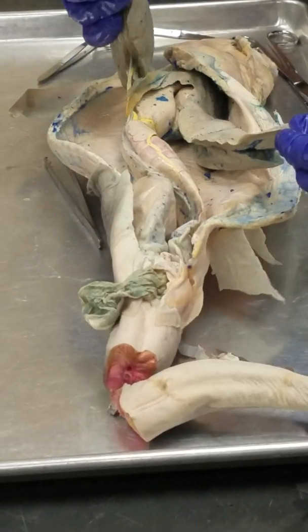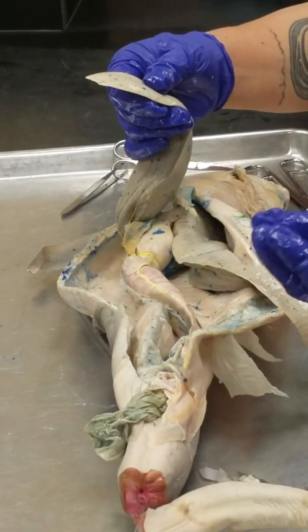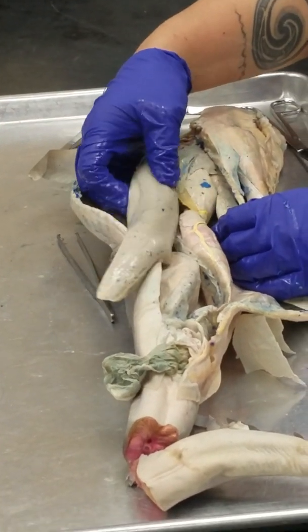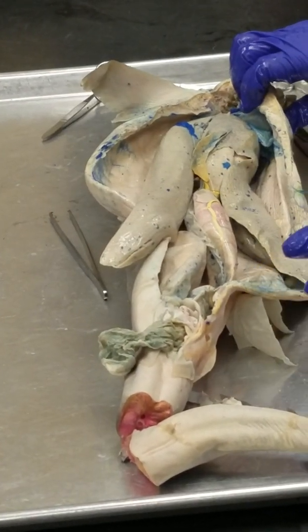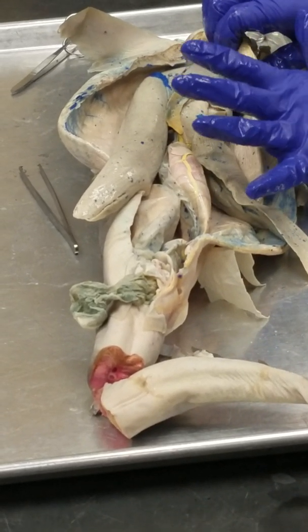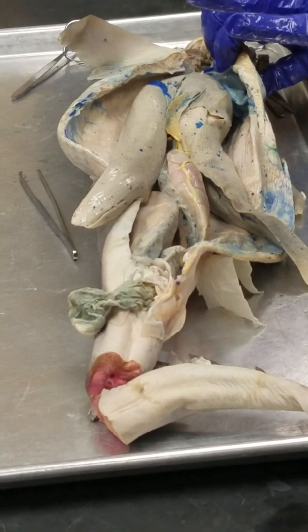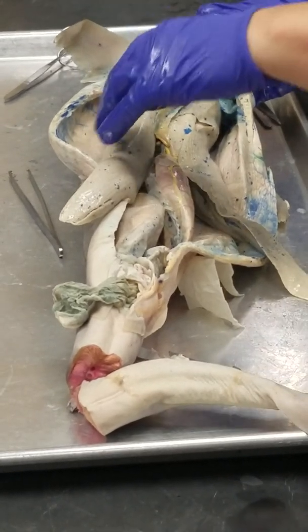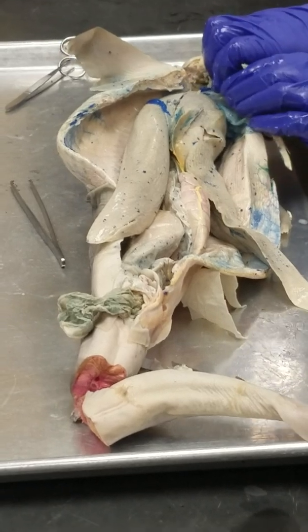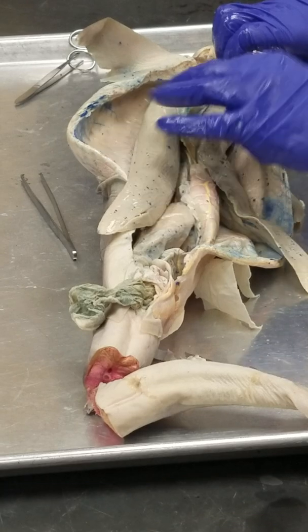The shark has this huge liver, and the liver produces an oil. Look at how gross that is. See? The oil is called squalene. Squalene is produced in buckets by the liver because the shark doesn't have a swim bladder. So you know when you pour oil into water, it floats to the top? So the oil, the squalene, helps to maintain buoyancy in the shark. So in the absence of a swim bladder, we have this giant liver.